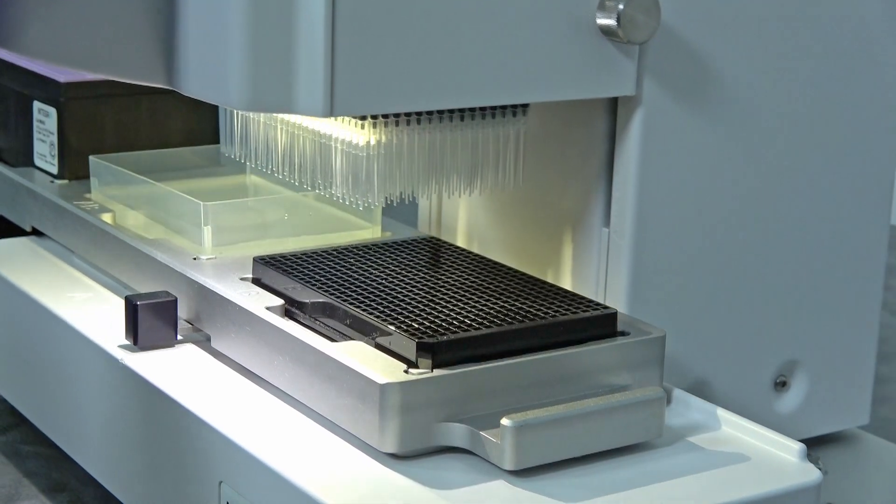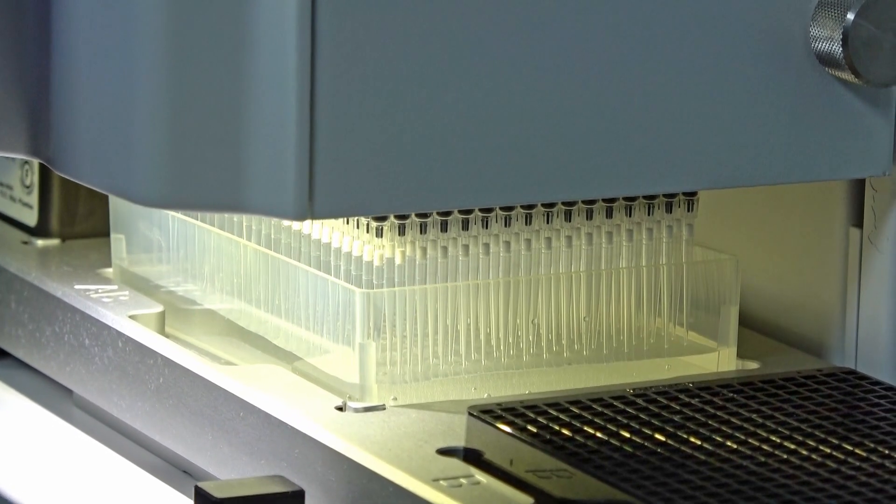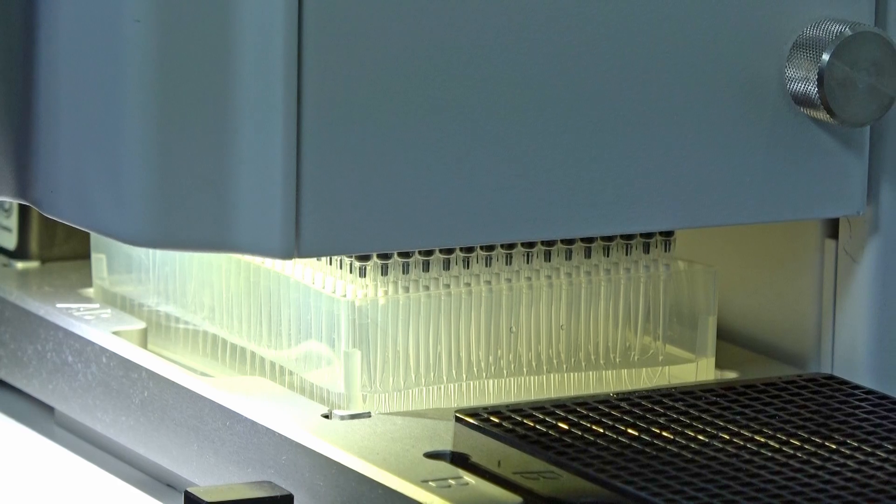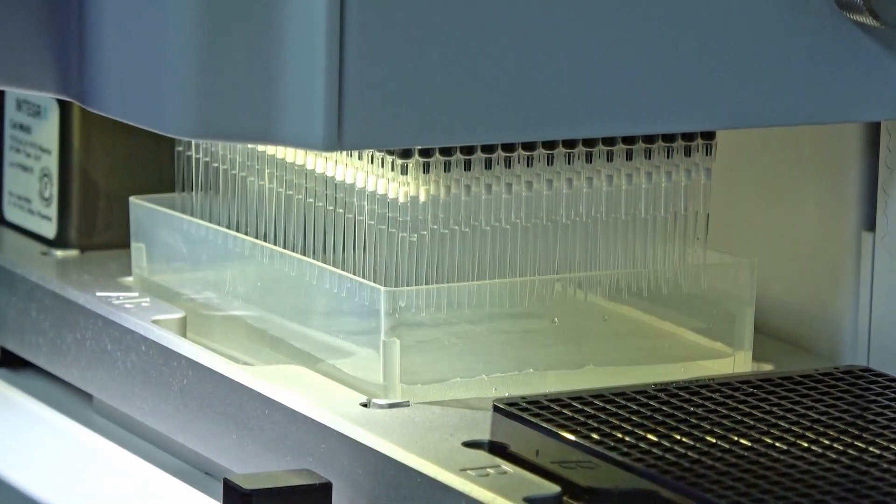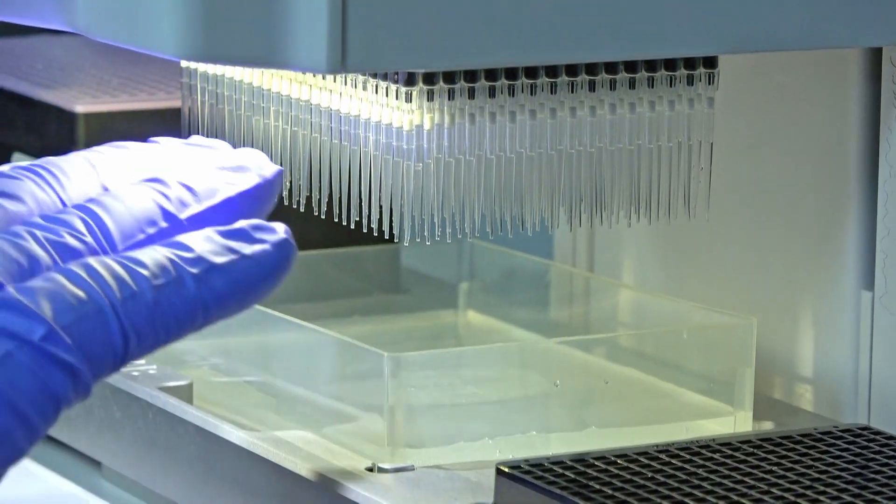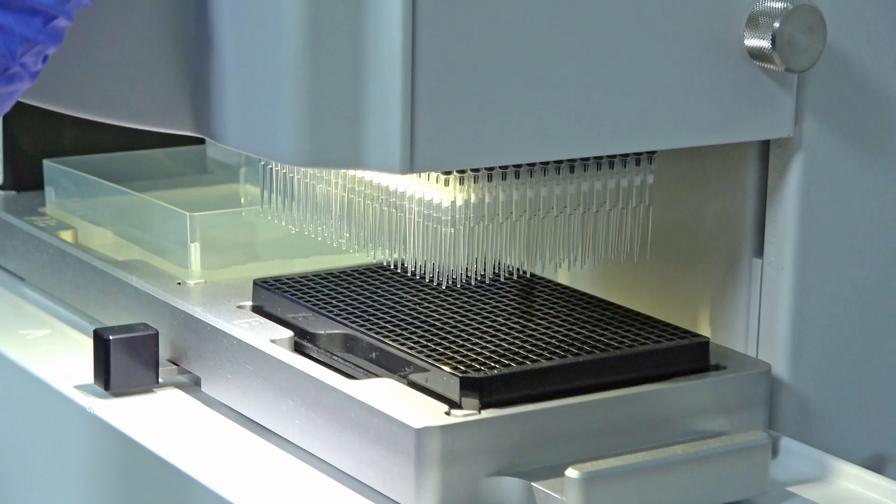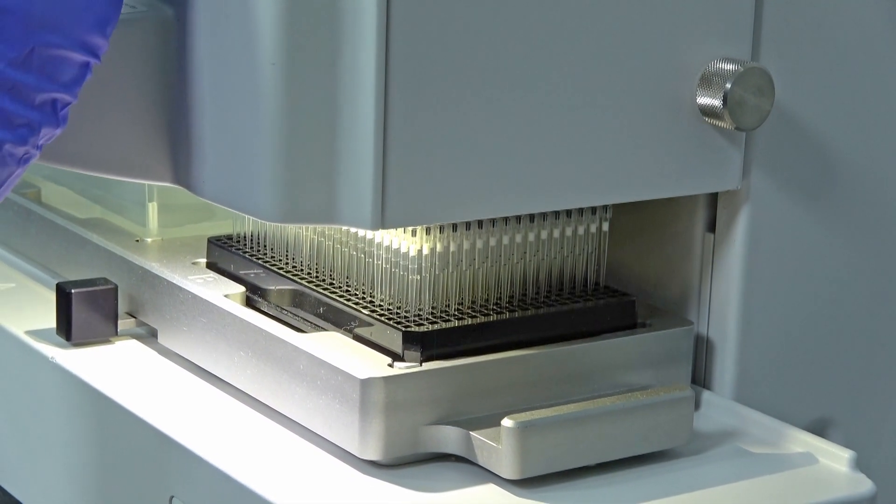One more time, come over and just hit run again to get the fluids. All right, and you can see just how nice and evenly that just aspirates all the tips there. Come back over again, come down.